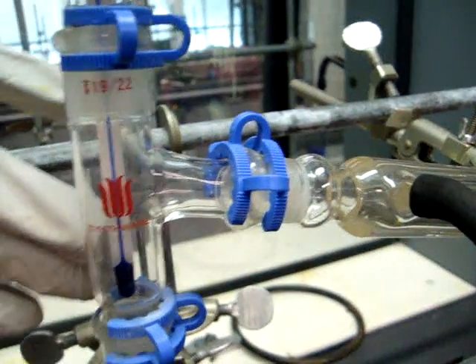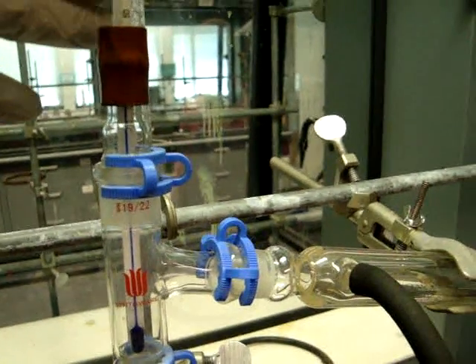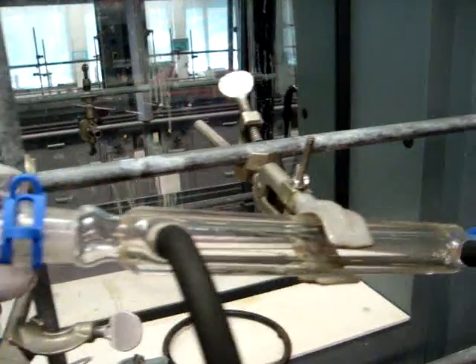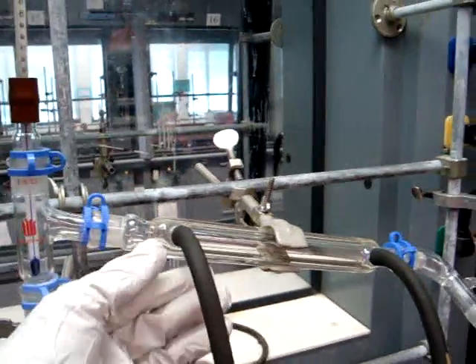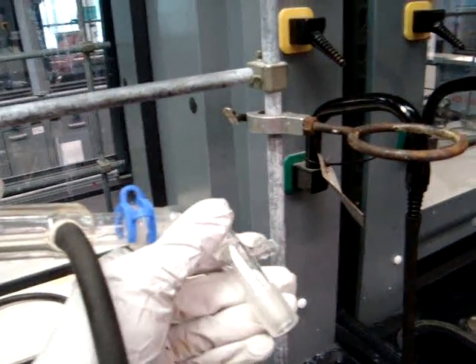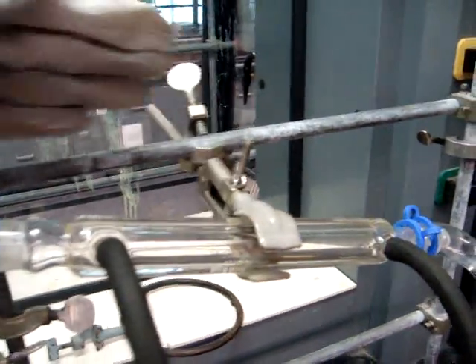You want to make sure that the thermometer is placed so you know the temperature of the gas when it goes into the condenser. Attached to the side of the distillation head is the condenser itself, with water in on the right side and water out on the left side. Moving down, you will then attach the vacuum adapter, which is where the receiving flask will go underneath.